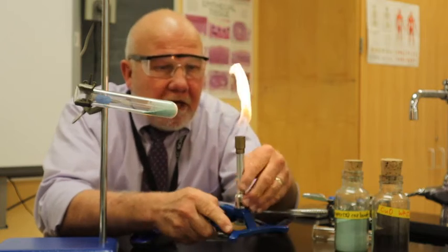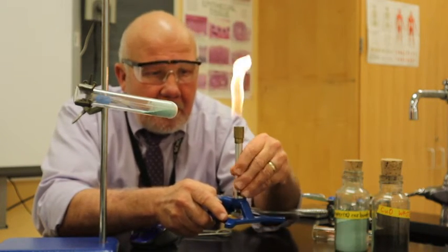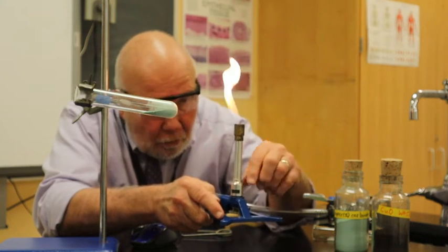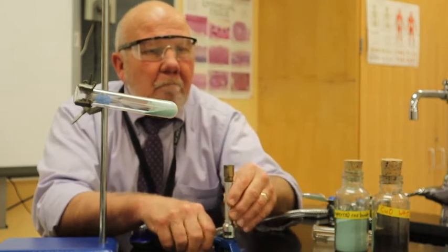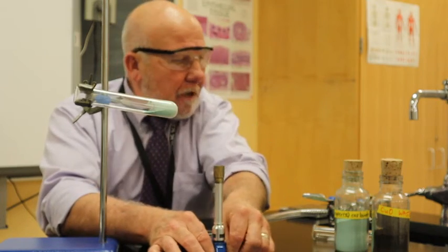Again, what I want to do is get a very hot flame. So right now I'm burning just gas coming out, natural gas. So I'm going to open this up so that through a little hole here, air can come through with a little gap at the bottom, and I get a bluer looking flame instead of that yellow. And I'm going to make it a little bit bigger.